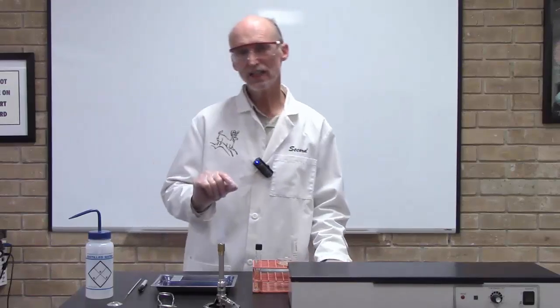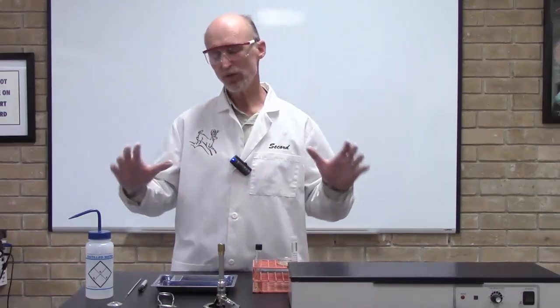Okay, now let's get started. First I'm going to talk about the equipment and supplies that you're going to need, and then we'll look at the technique.